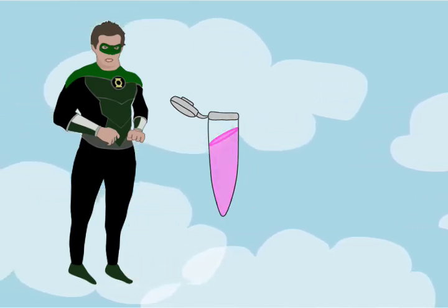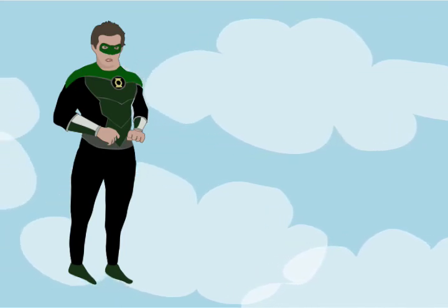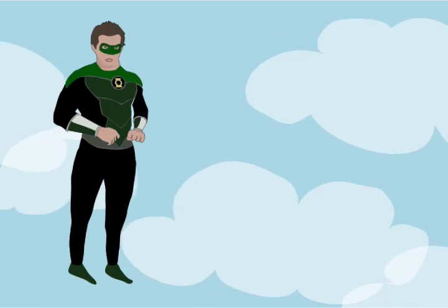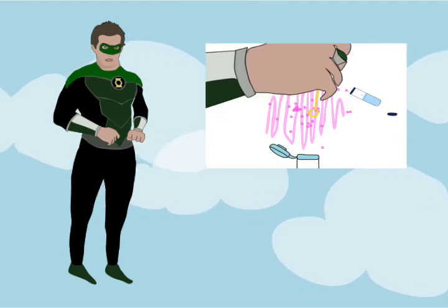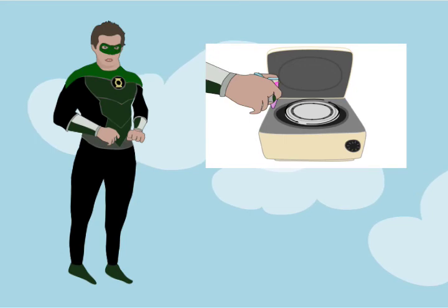To get a proper result in the end, there are a few mistakes that can be made that we need to be aware of. The most common problems are made when someone is not being careful. Some of these problems include pipetting improperly throughout the whole lab, scraping a petri dish too harshly, and disturbing the pellet during and after centrifuging.